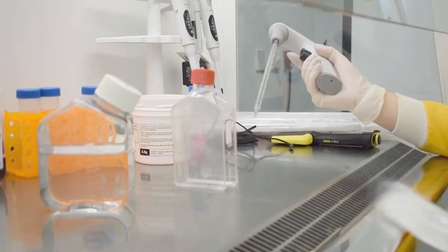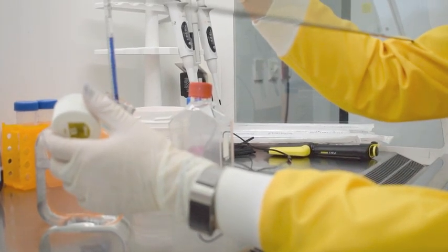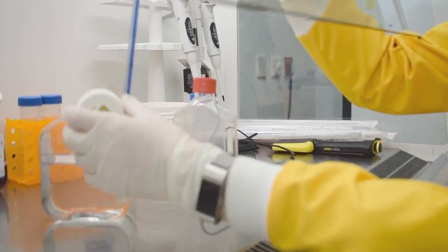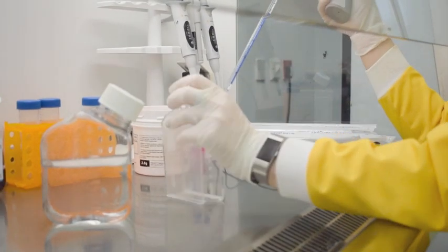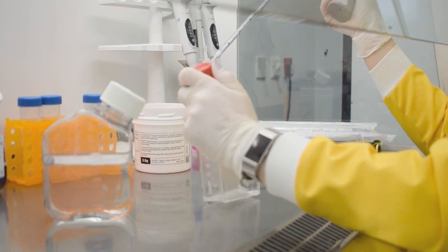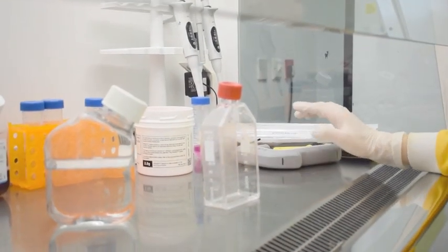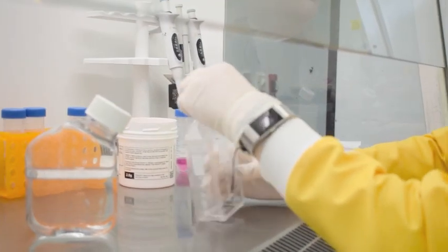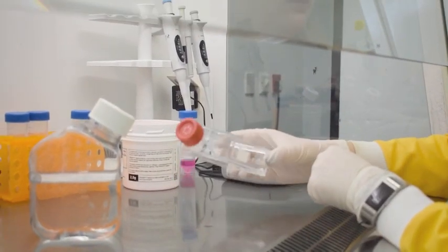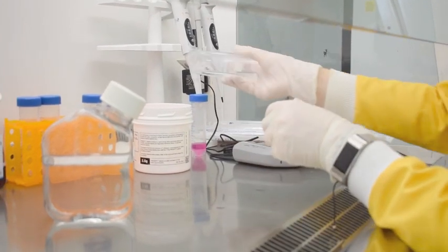The cell layer is then washed in 5ml of PBS or phosphate buffered saline. PBS is then discarded by pouring.